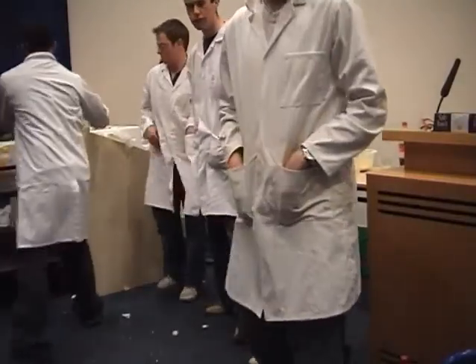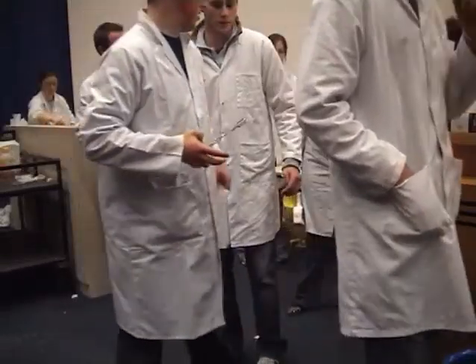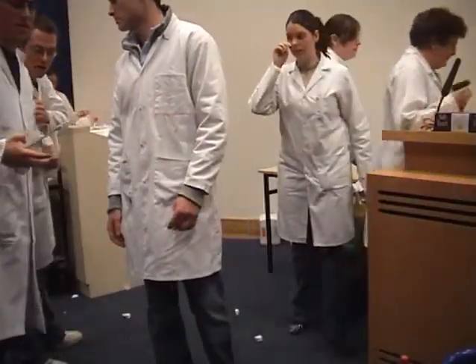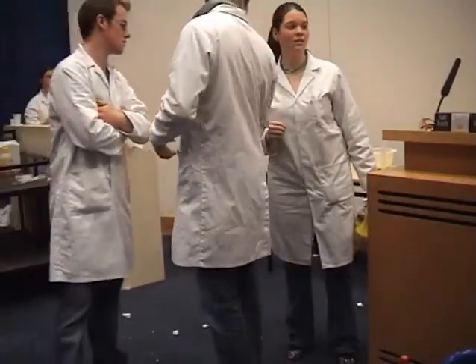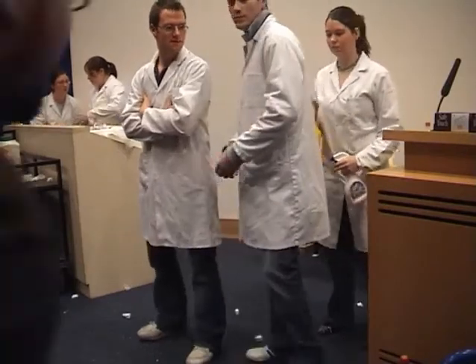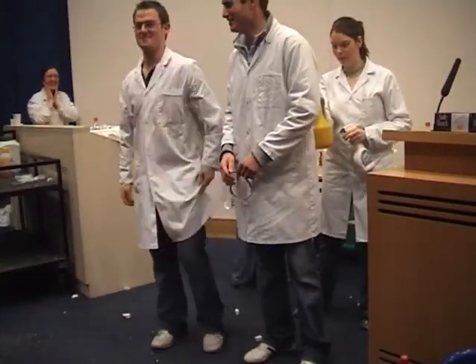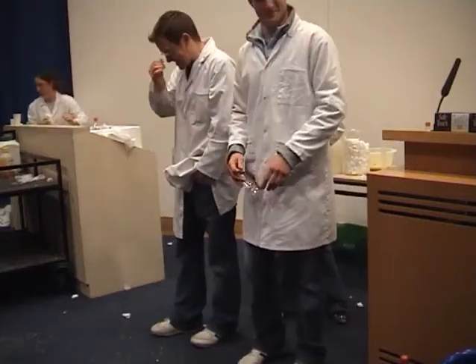Okay, does anybody have a piece of paper? Can I just get a piece of paper, please? Thank you very much. Okay, what I'm going to do now is burn paper. What I have here is ethanol. Now, ethanol is basically the alcohol in every alcoholic drink. So, just ethanol in here with a piece of paper. Get this going.